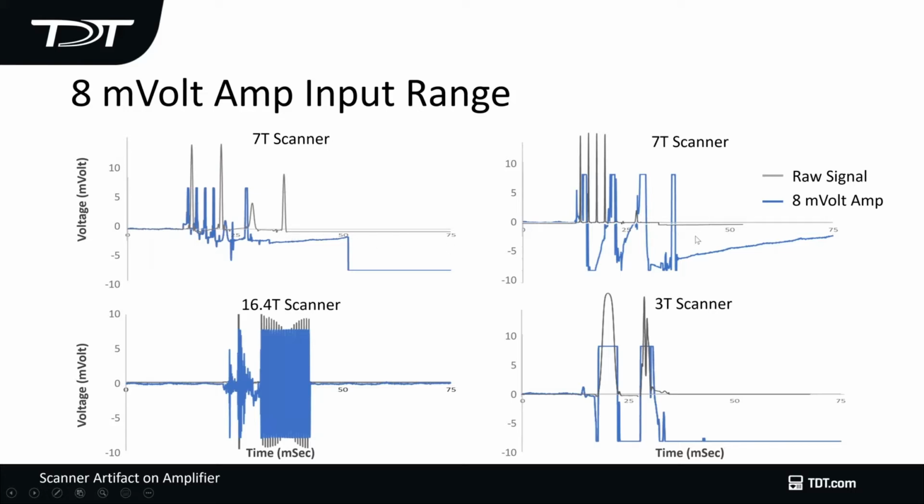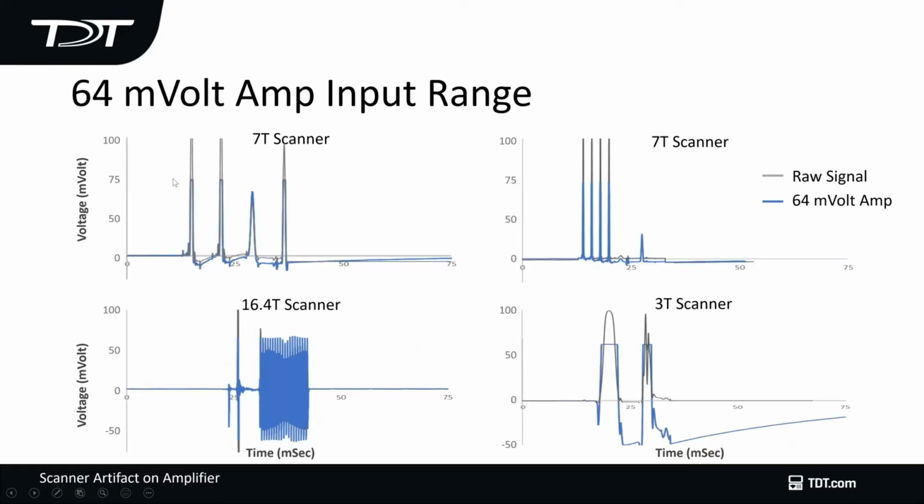Here's another example with a 7T scanner, a 16.4T scanner, and a 3T scanner. And you can see that depending on the amplitude of the artifact, you're going to lose more and more of your signal. So you have to have a large input range. Here's an example with a 64 millivolt input range, and you can see that even now I'm still saturating my signal and I'm not recovering completely.